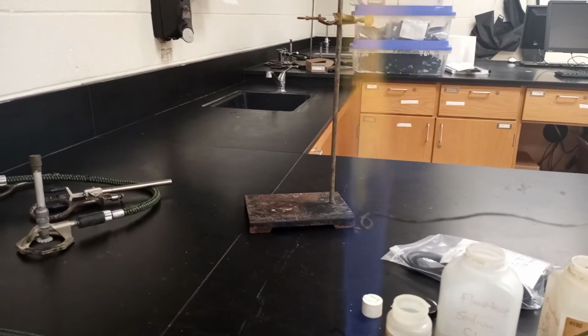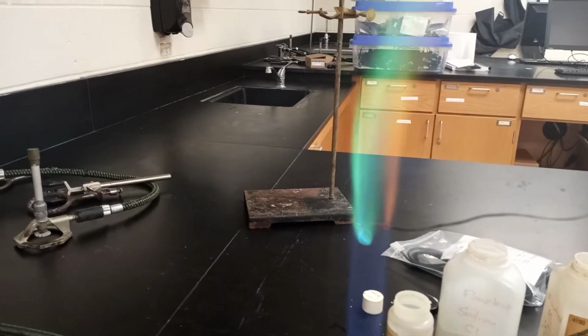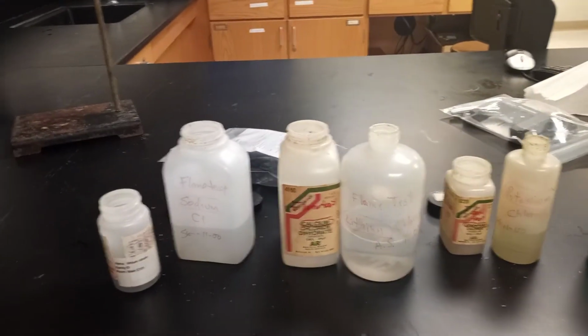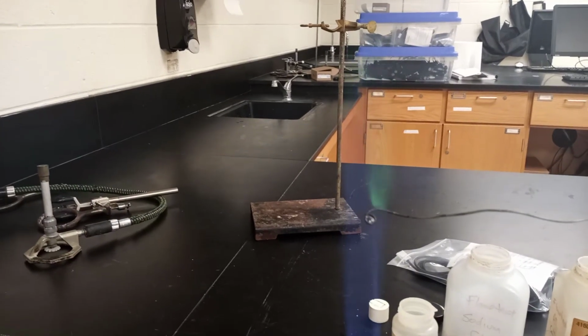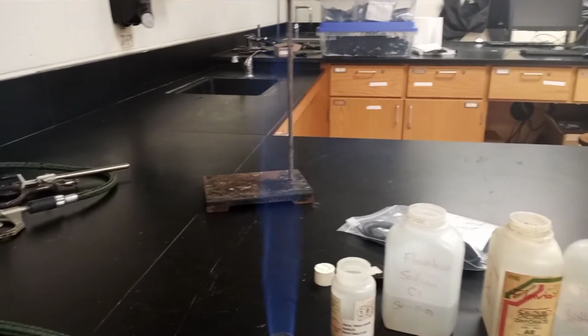This one here, got a couple different things here. I'm going to do this again, but there it is. That green color is really a nice one. I don't know if the light would work real well when it's off. I didn't think it would show up real well with the light off. Maybe I'll try it again with the light off. Okay. All right, there we go. Okay, so green.